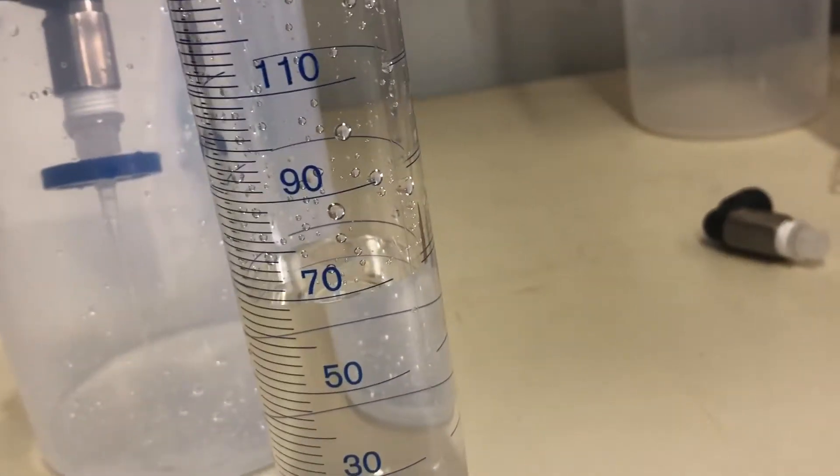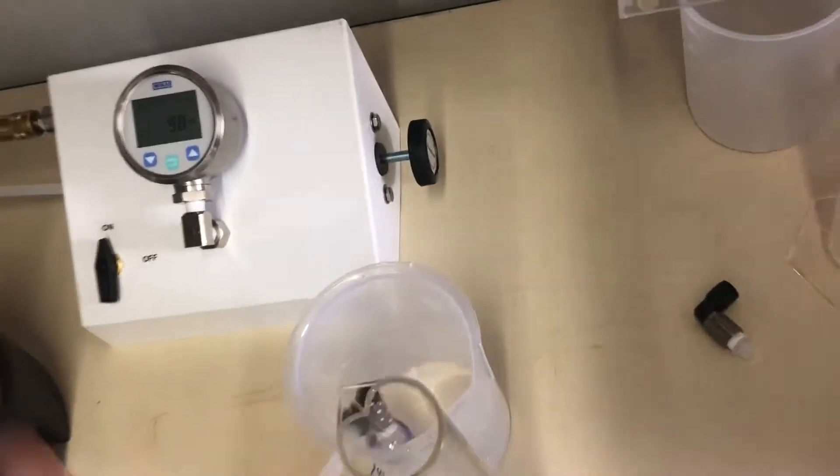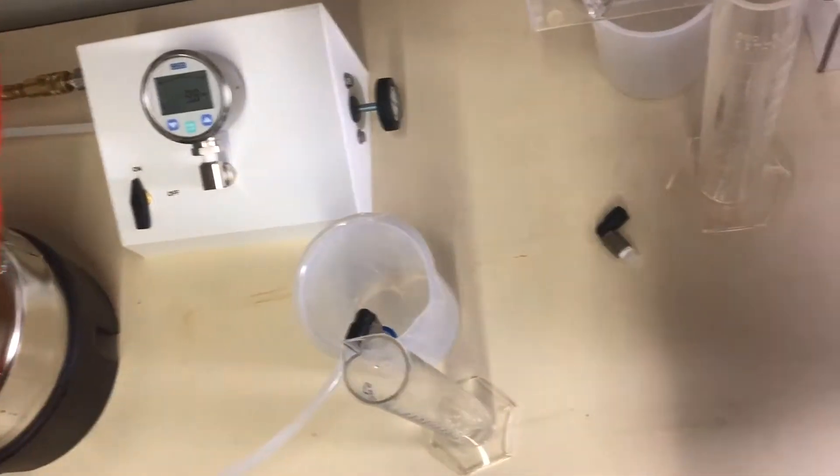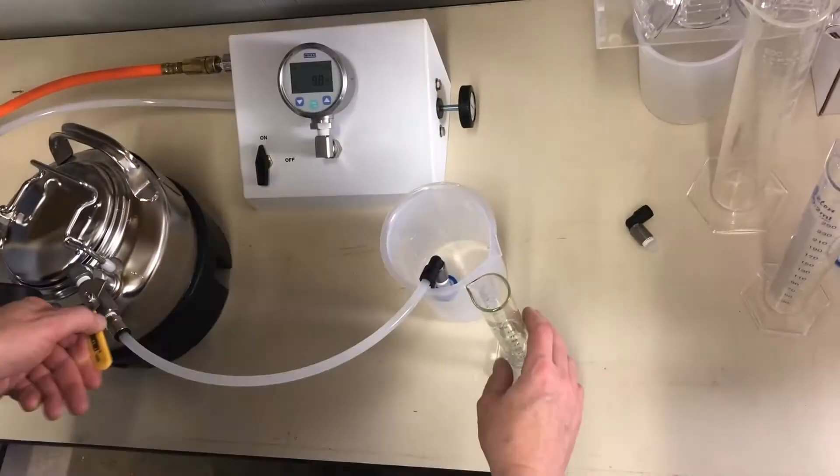While that's doing that, let me grab the 100 milliliter graduated cylinder.